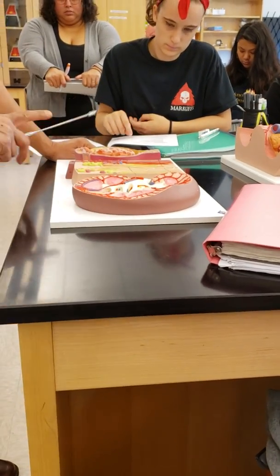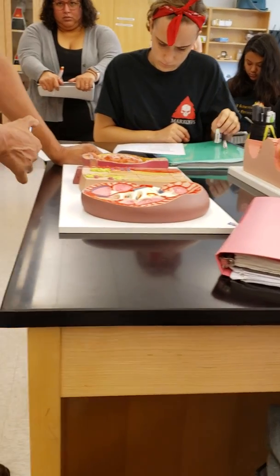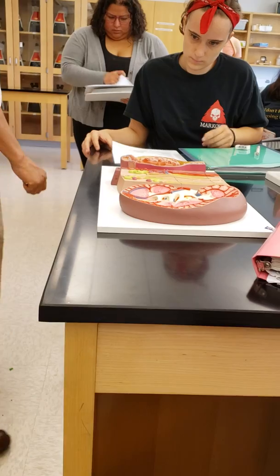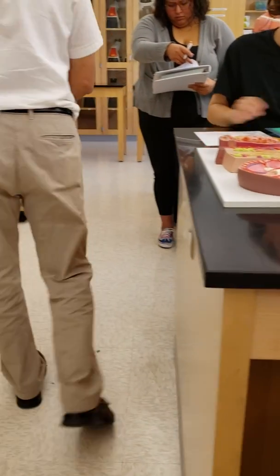Histology, okay. Let me show you the slide. I think you don't have dissection. Let me see here, if you have a kidney here. If you have a kidney here, let me show you how it looks from inside. Okay. Let me show you.